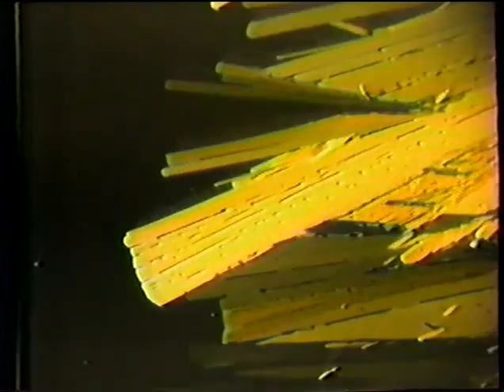Now I want to show you a very unusual phenomenon. I referred earlier to crystal strain, and this is really anisotropic within the crystal lattice. This is a compound developed as an explosive. It's a nitramine, bis-beta nitroethyl nitramine. And it grows with 4 different polymorphic forms, but what I'm going to show you is not polymorphism, but you will be amazed at what it does.